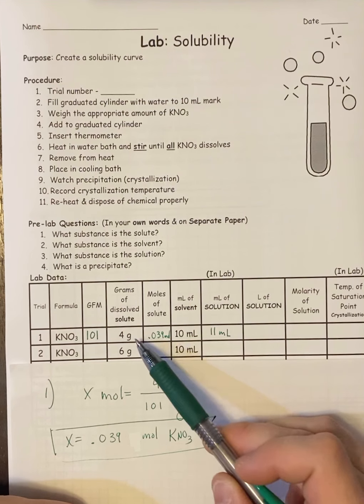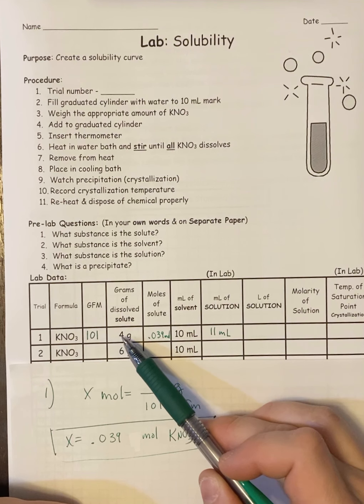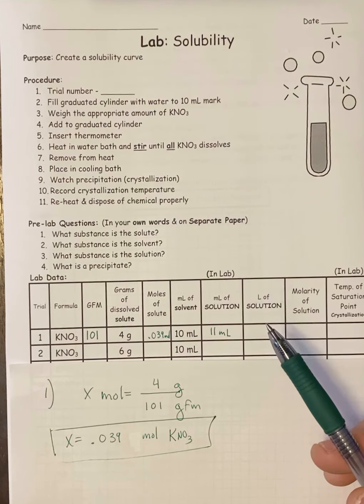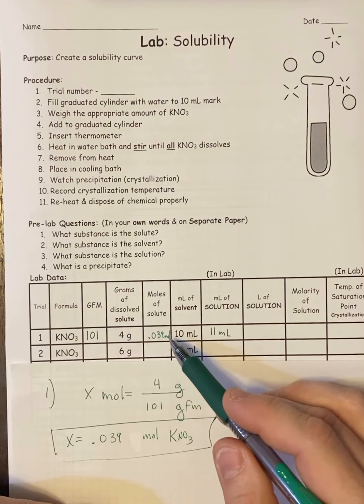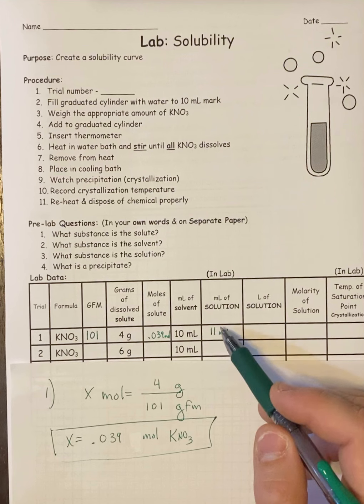Even when you mix 2 liquids together, sometimes they don't directly add. Like if it was 4 milliliters of alcohol and 10 milliliters of water, it's not going to equal 14 milliliters of a new solution, believe it or not. Not all the time. Sometimes it does, sometimes it doesn't. So you just have to be careful about that. These have to be taken once the 4 grams is fully dissolved into the 10 milliliters of water. So you're going to do these numbers once you're done.